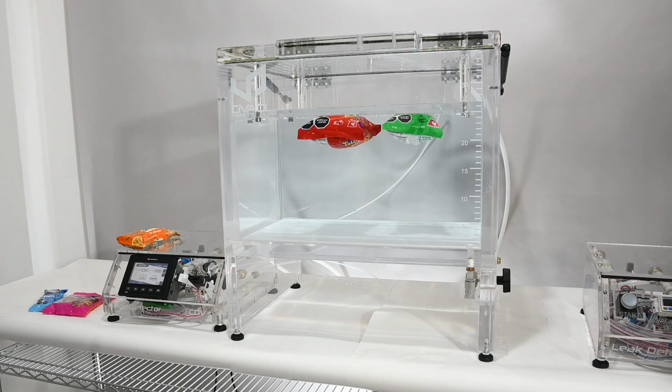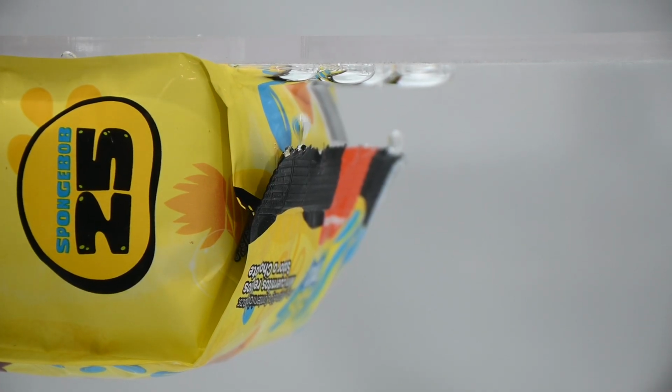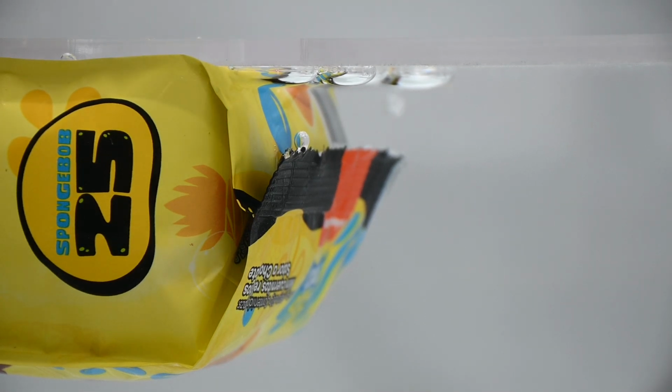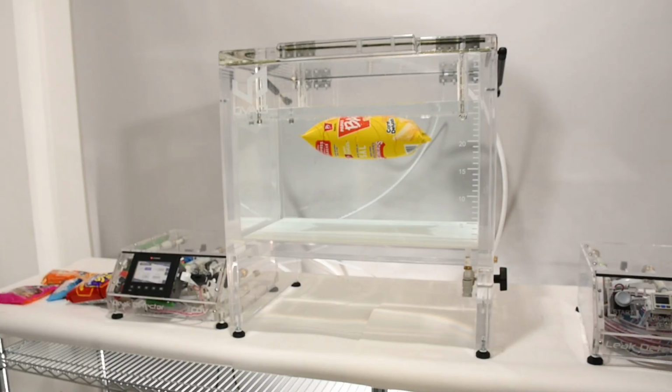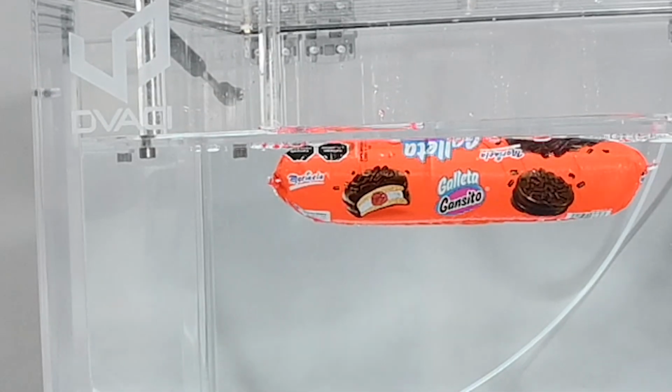It was fascinating to see bubbles escaping where there were leaks due to small sealing defects. And yes, some packages even exploded when we increased the vacuum level. These tests show how crucial it is to control the quality of packaging with our DVACI test chambers. Airtightness is serious, especially when it involves food that we consume every day.